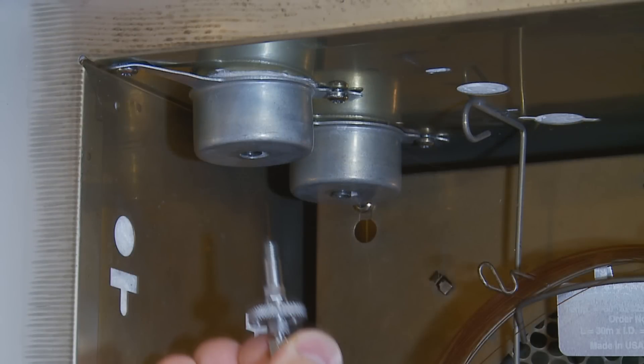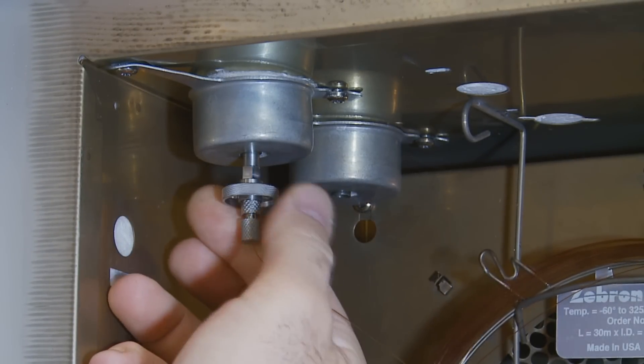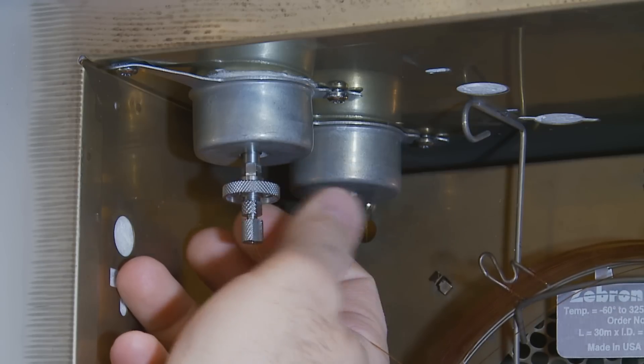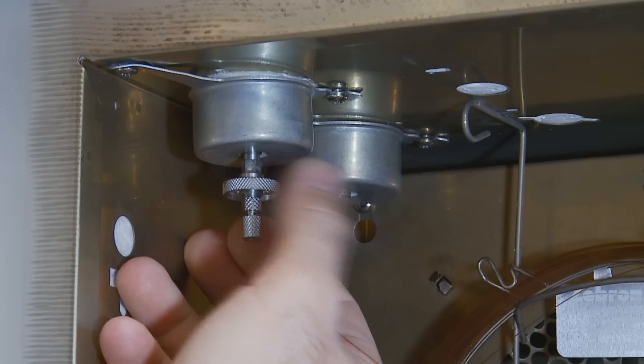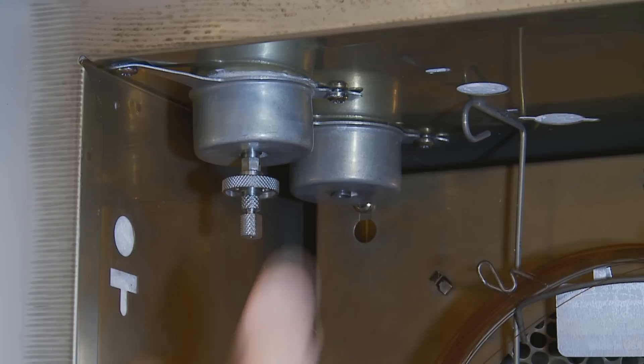Hold the cool lock nut by the locking section. Insert the column into your instrument fitting. Rotate the main body until you start to feel resistance. Then, make sure to fully extend the locking section. Your cool lock nut is secure when the locking section does not move up and down.